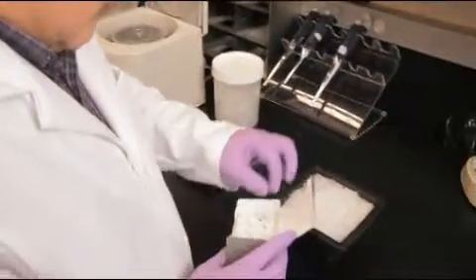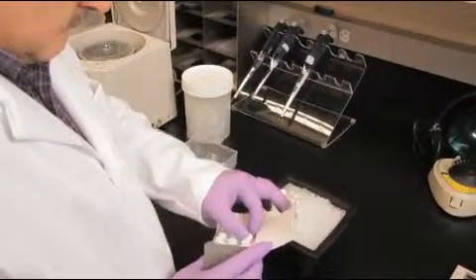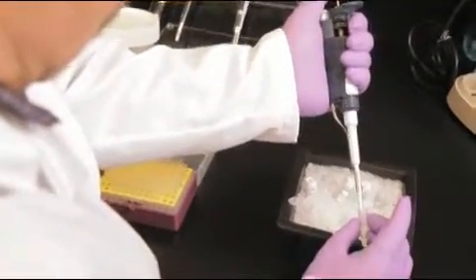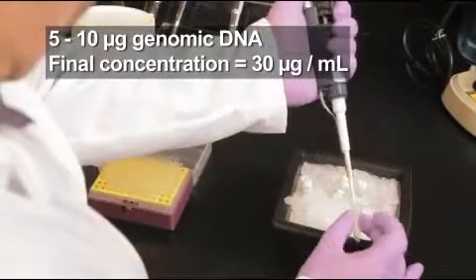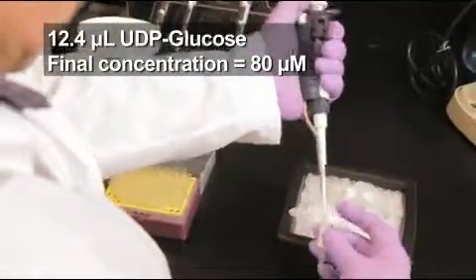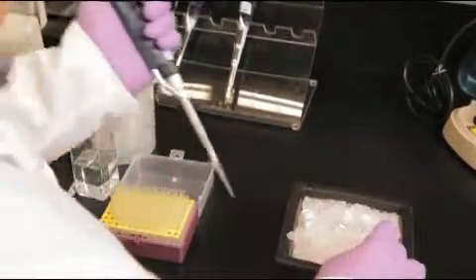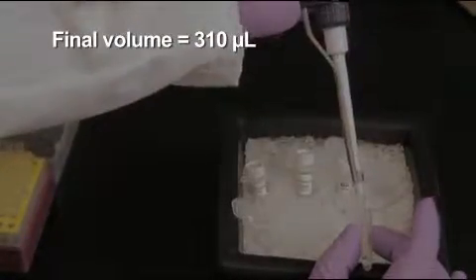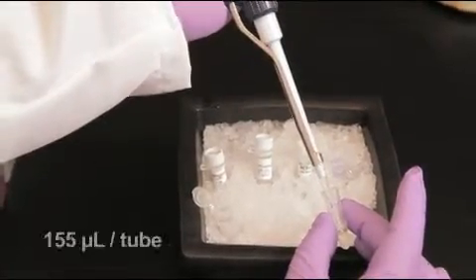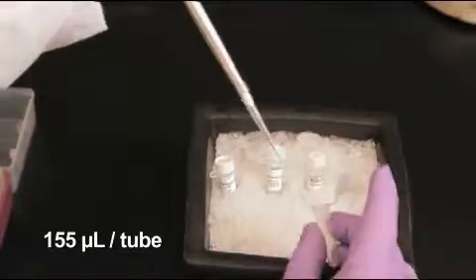Prior to the start of this protocol, purify the genomic DNA from Balb C brain tissue as described in the written procedure. In a 1.5 milliliter reaction tube, mix the genomic DNA, UDP glucose, NEB buffer 4, and enough nuclease-free water to bring the total volume to 310 microliters. Split this reaction mixture into 2 tubes of 155 microliters each.